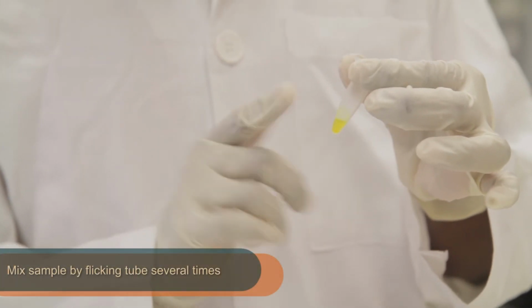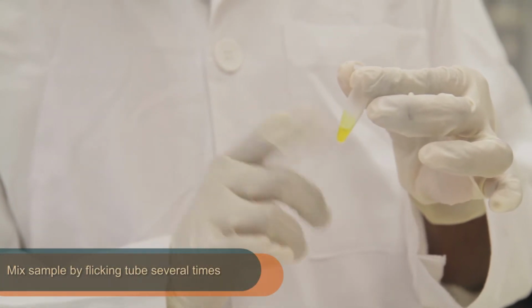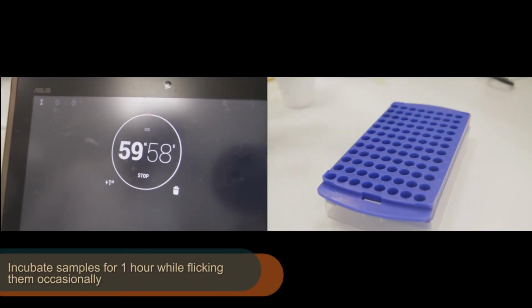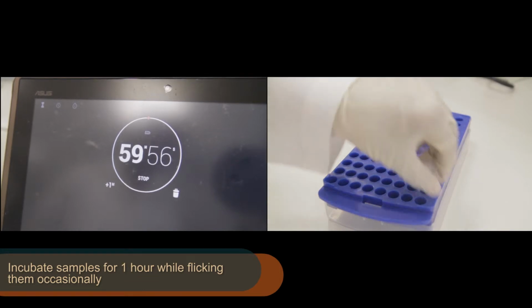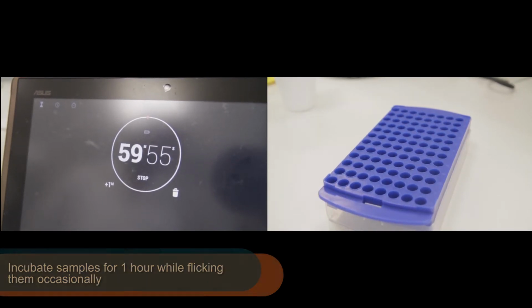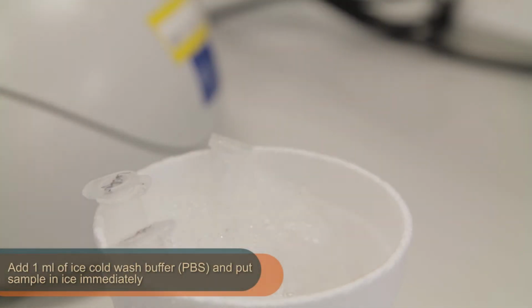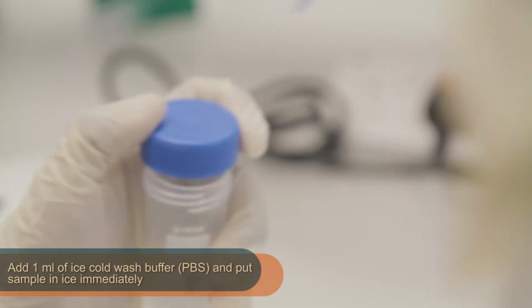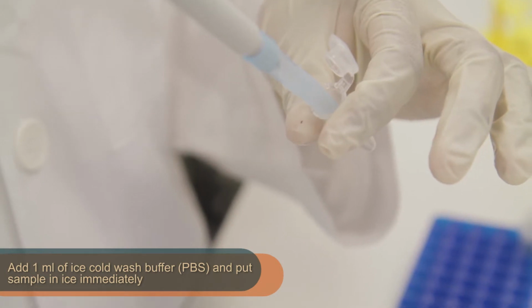Then, mix the sample by flicking the tube several times. Incubate both samples at room temperature for an hour, flicking them occasionally to aerate the samples. Subsequently, add 1 ml ice-cold wash buffer and immediately place the samples in ice.